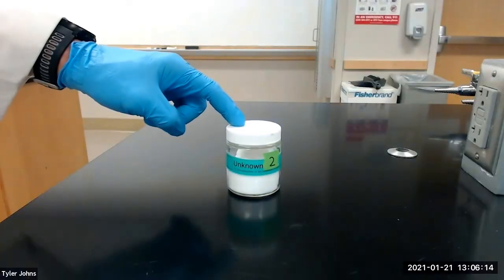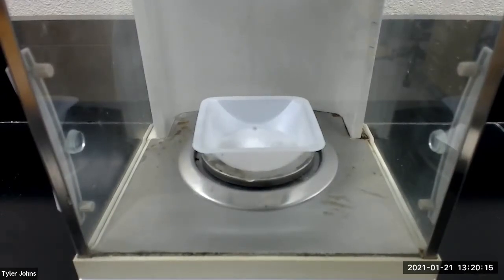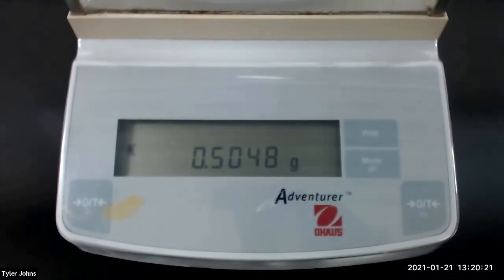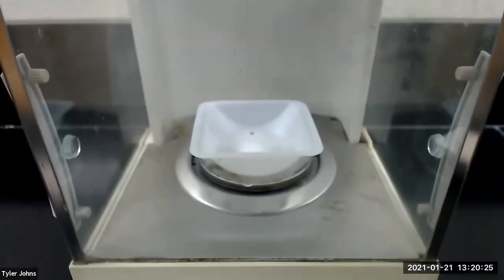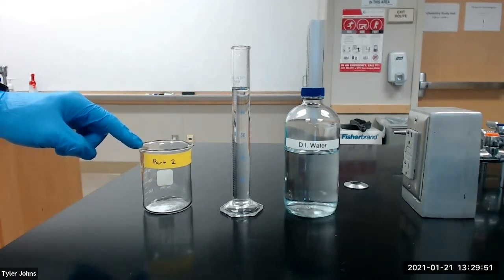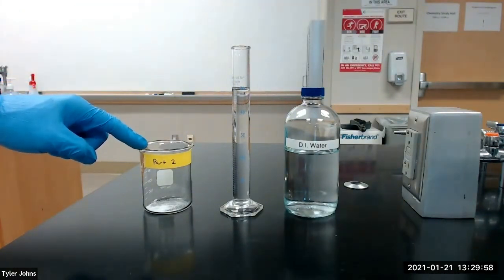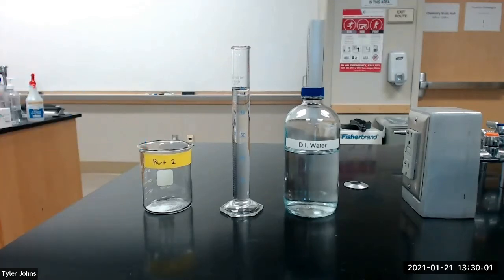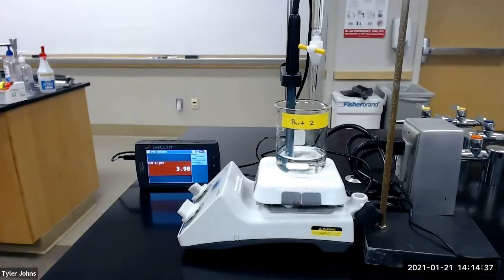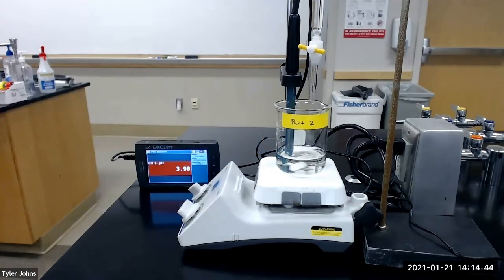We will next weigh out the calculated quantity of the unknown acid. The mass of unknown acid number two that we will be using for part two of this experiment is 0.5048 grams. I've added the unknown acid number two to a 250 milliliter beaker for part two. We will next add approximately 50 milliliters of deionized water to the beaker to dissolve the acid. While the acid is dissolving, we will set up our apparatus for the titration. All of the unknown acid has now completely dissolved and we have set up our titration apparatus.